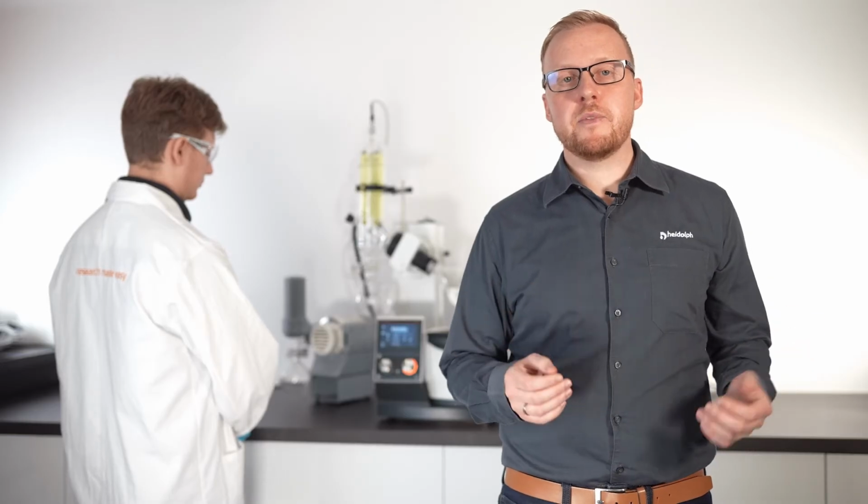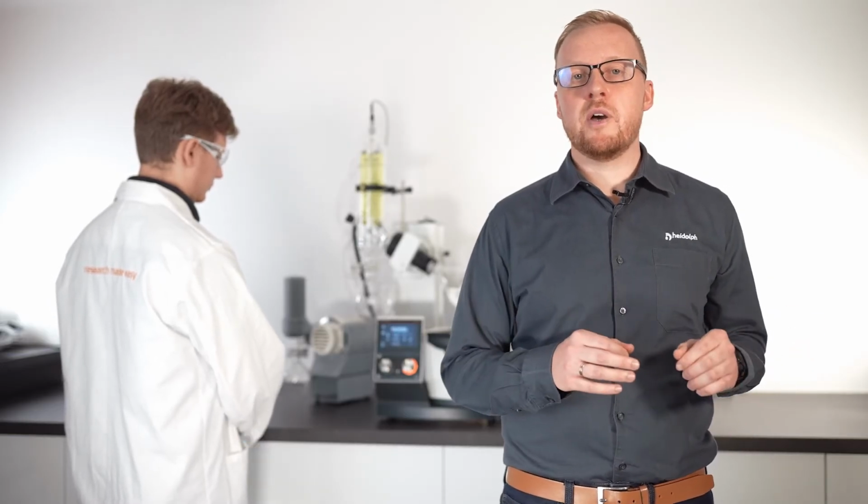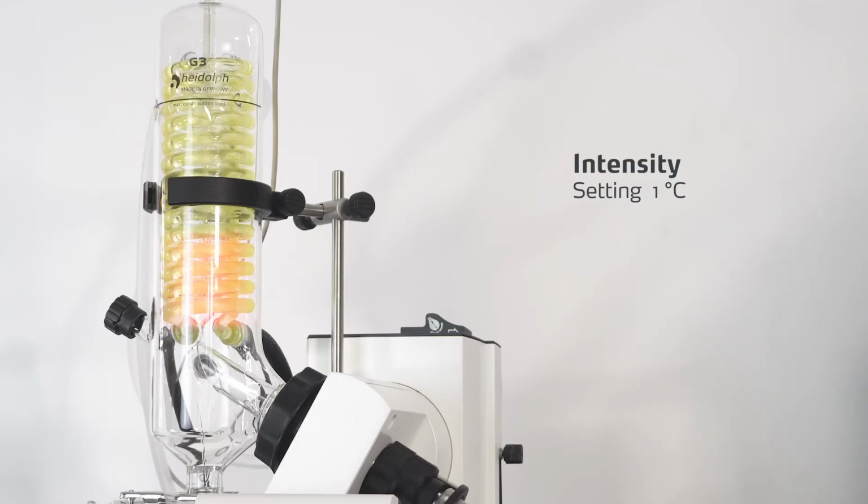Also noteworthy, you can fine-tune the efficiency of your automatic evaporation with an allowed delta-T value. For example, if you work with a strong cooling source, you can adjust the tolerance of the sensor to keep the automatic evaporation always on the most efficient level according to your physical system limits.